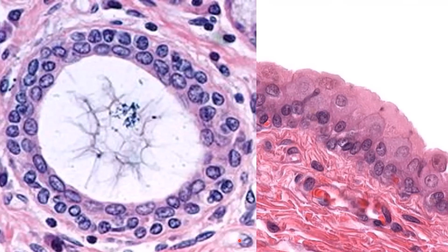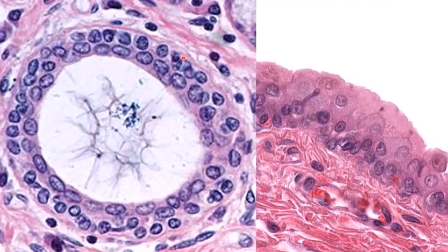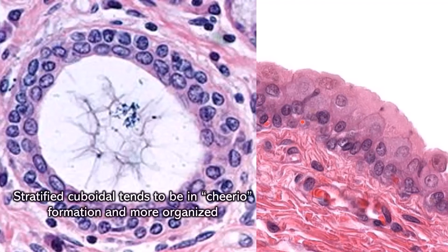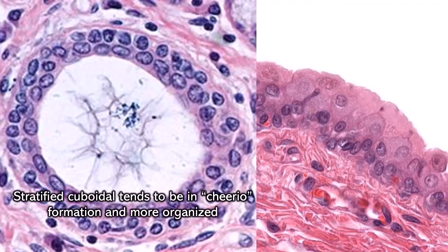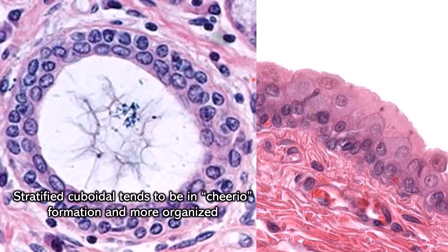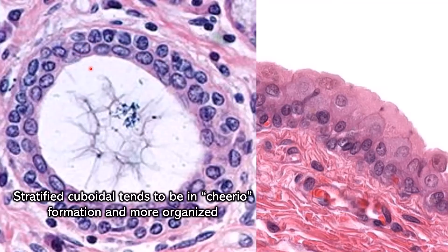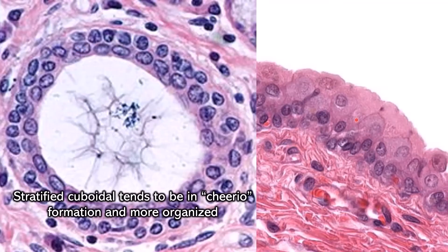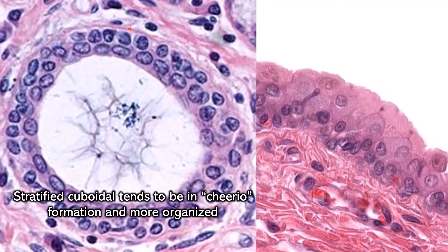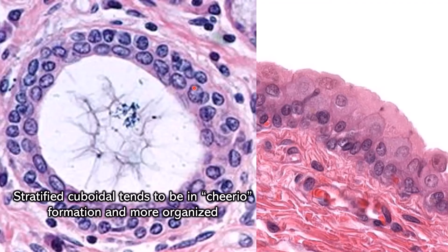I have seen some students misidentify this, which is stratified cuboidal, as being transitional, or vice versa. But stratified cuboidal tends to look more organized — meaning the nuclei are in nice rows rather than all over the place like you see in transitional. And usually it's also in a cheerio formation because you're finding it in ducts of glands.